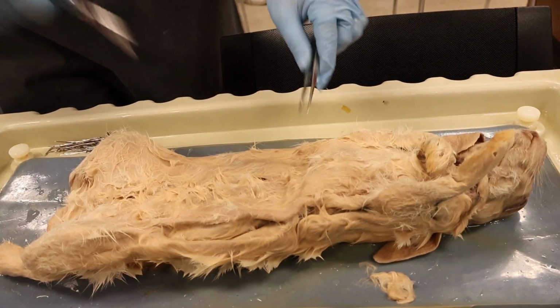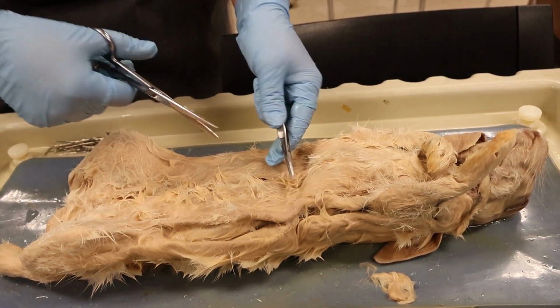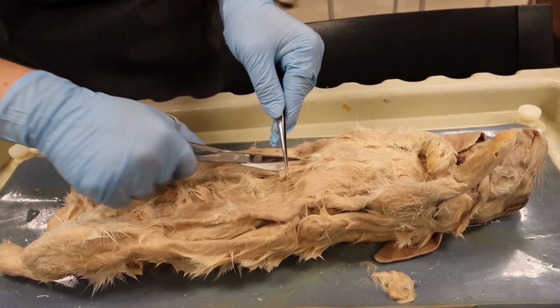Okay, so in the first clip we did discuss the integumentary system as well as some of the adaptations involved in this body system. I did want to touch on this a little more clearly and concisely, as there was some background noise from other groups doing their videos.